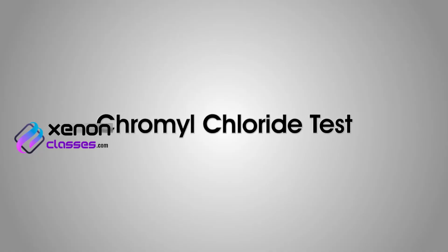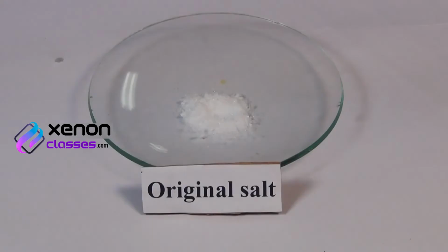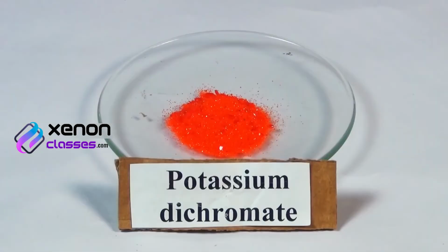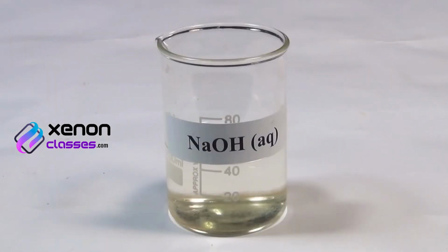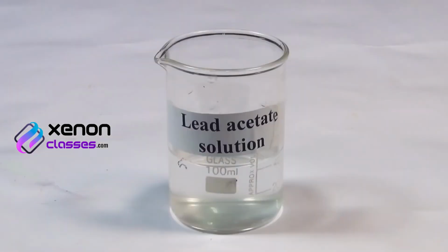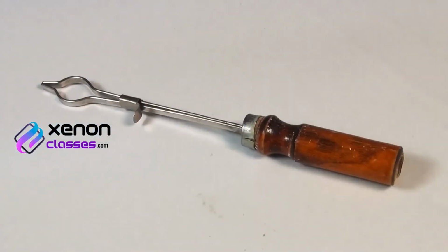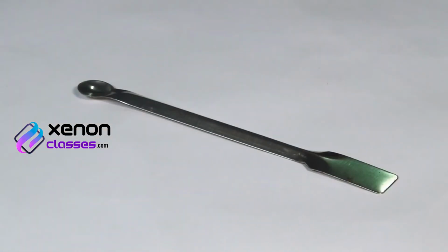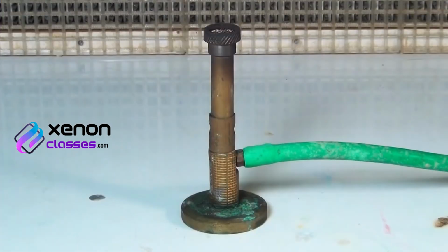Chromyl chloride test. Materials required: original salt, powdered potassium dichromate, concentrated sulfuric acid, sodium hydroxide solution, dilute acetic acid, lead acetate solution, test tube holder, spatula, glass rod, droppers, and a Bunsen burner.